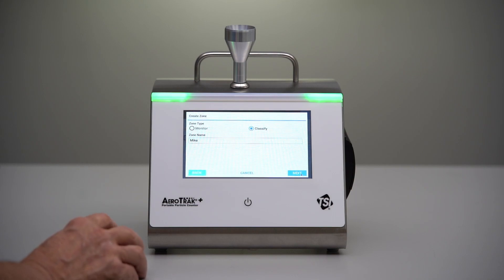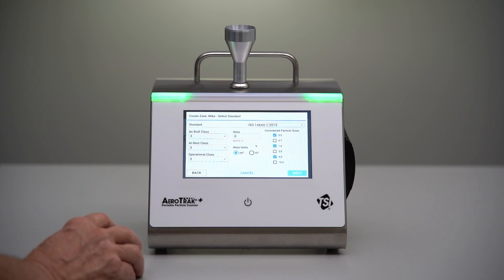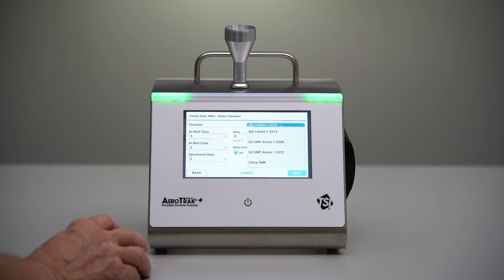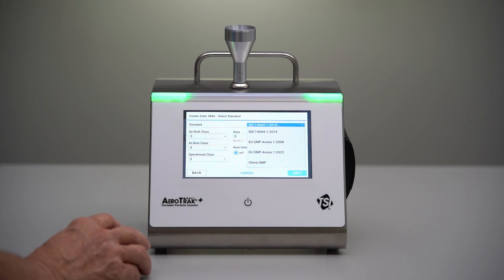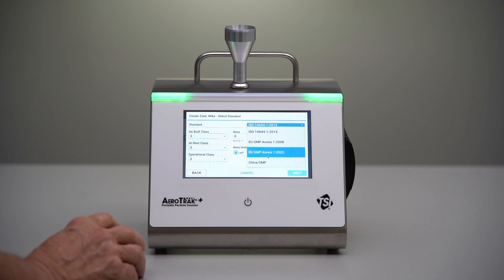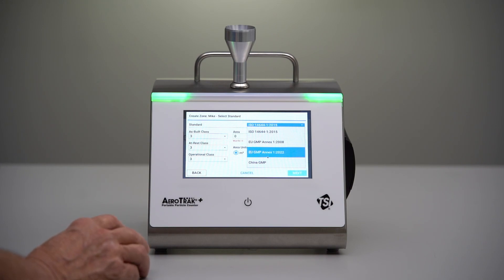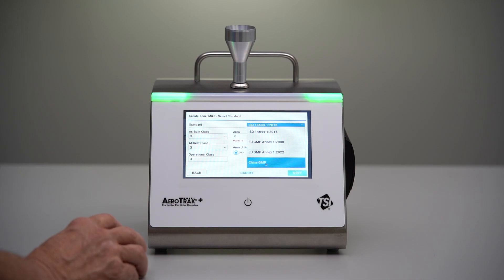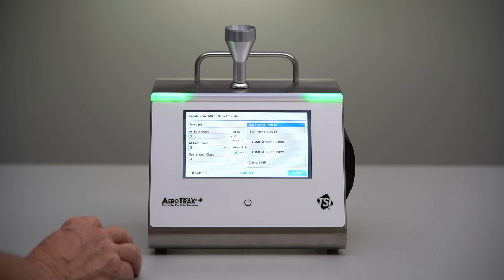We're ready to input the data that we need. In order to create a formal classification zone, we need to select the standard that we want to test to. We're going to use ISO 14644 current version, but importantly we do have preloaded the GMP Annex 1 2022 current version as well as China GMP, so you can select those templates as well if you want to.